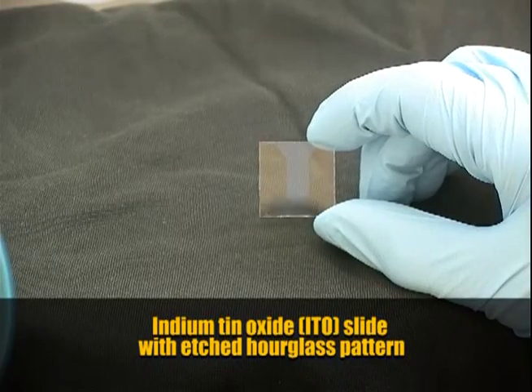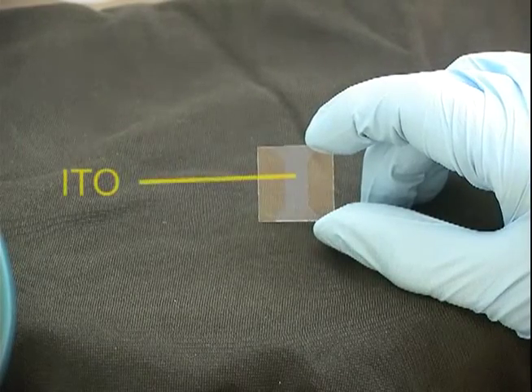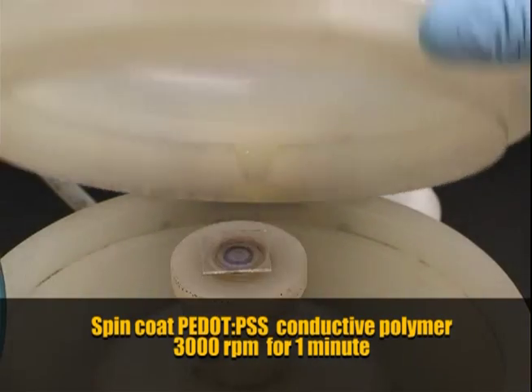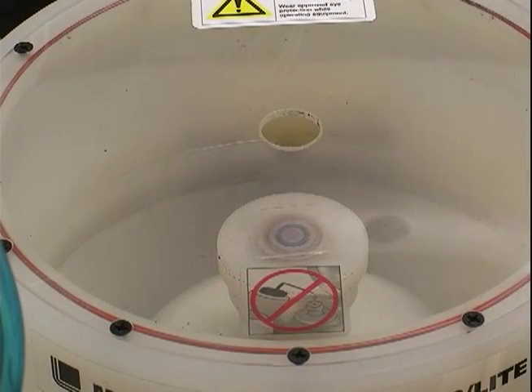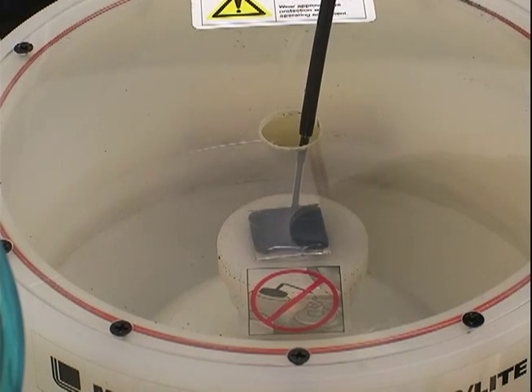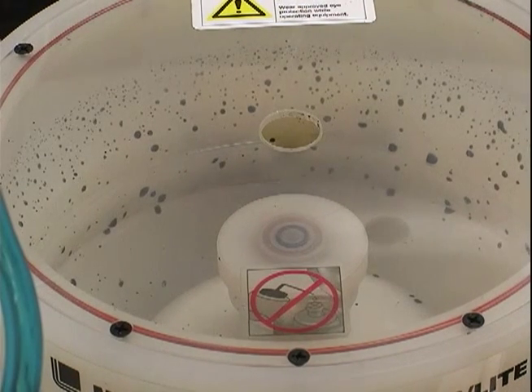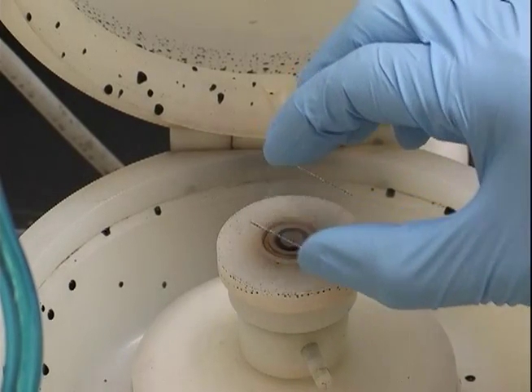This is a one-inch square glass substrate coated with indium tin oxide, our transparent conducting oxide. We've etched out an hourglass pattern and we're getting ready to spin coat our PEDOT:PSS polymer layer. We set our substrate on the spin coater and use the vacuum to hold it down. We deposit one layer of filtered PEDOT:PSS, adding just enough to cover the entire surface. We do this at a spin rate of 3,000 RPM for one minute. After one minute, we transfer the substrate to a 120-degree hot plate and heat for 10 minutes.